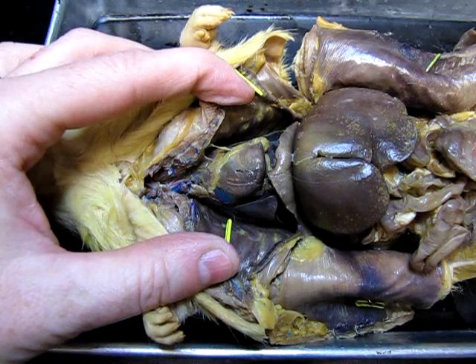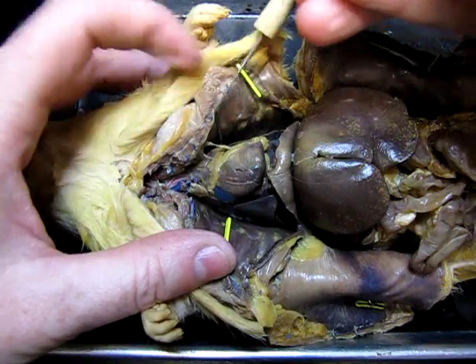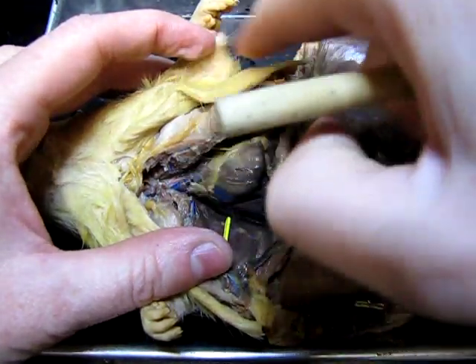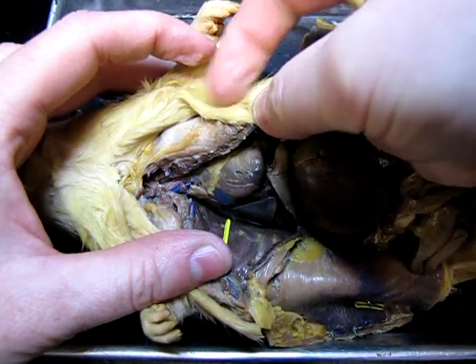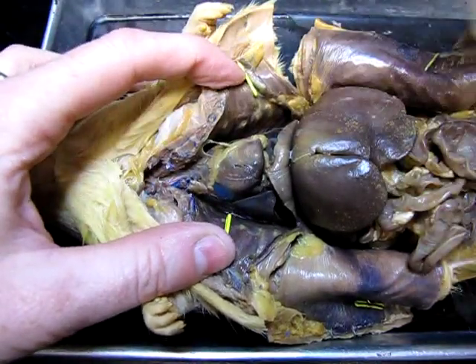So now we're looking at the rat as another example of a mammalian animal. On the rat, it's much easier to see that really distinctive mammalian feature of the fur. Again, we find fur or hair on the bodies of mammals, so it's a uniquely mammalian feature.